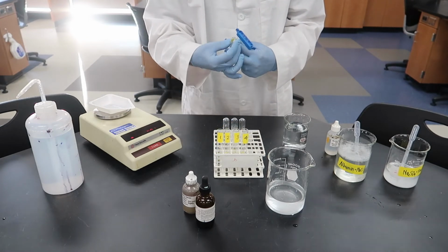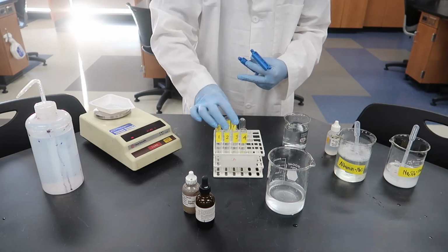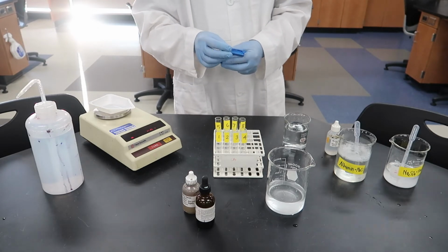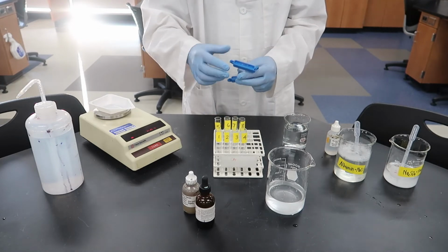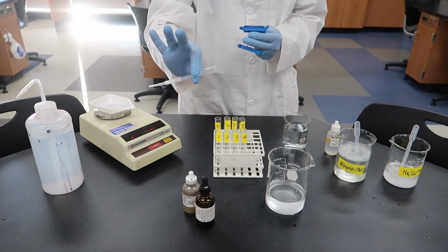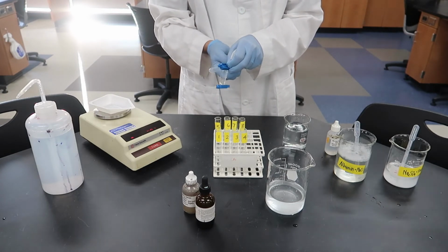Okay, and I'm just getting our test tubes ready so that we can run the exact same procedure we did at the beginning. We're going to take some liquid from the bag itself and liquid from the beaker, and we're going to put those in the test tubes. We'll put the liquid from the bag, albumin and NaCl mixture, in test tubes 5, 6, 7, and 8. We'll put the liquid from the beaker into test tubes 1, 2, 3, and 4.